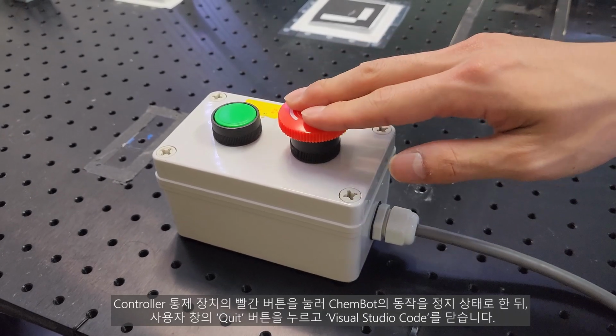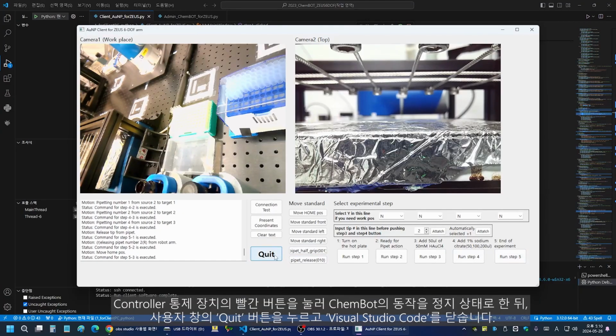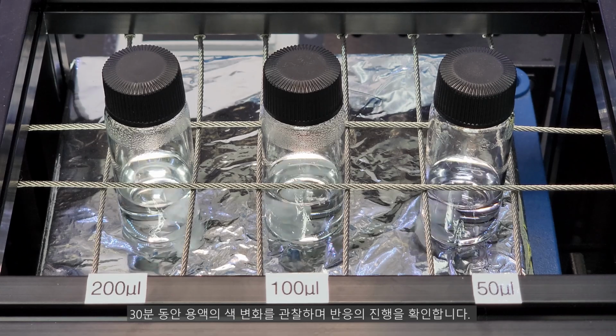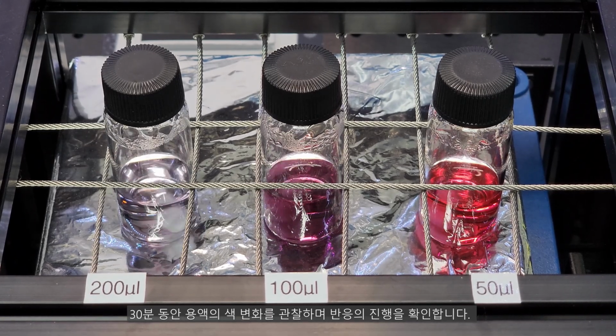Press the red button on the controller unit to stop ChemBot's operation. Then, click the Quit button in the user window and close Visual Studio Code. Observe the color changes in the solution over the next 30 minutes to monitor the progress of the reaction.